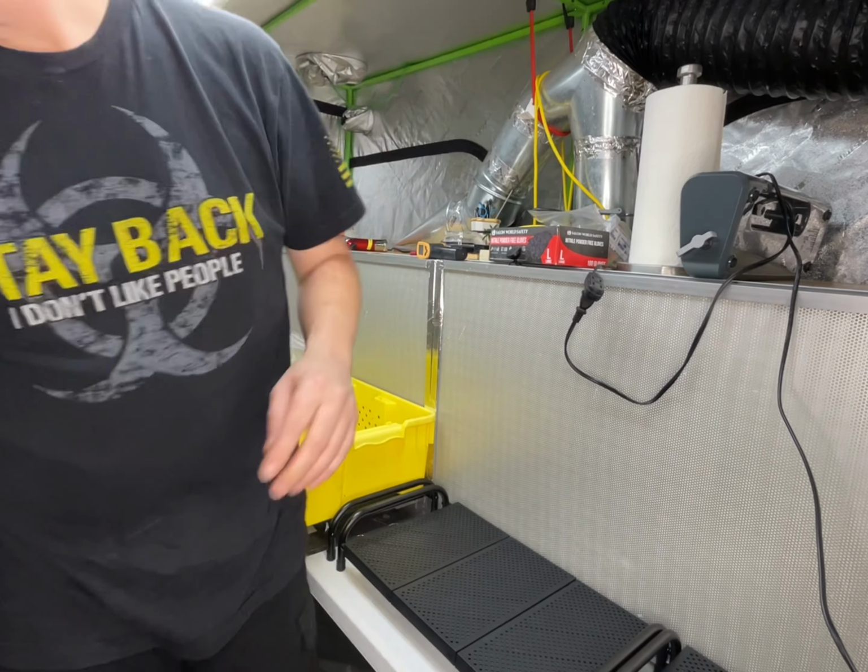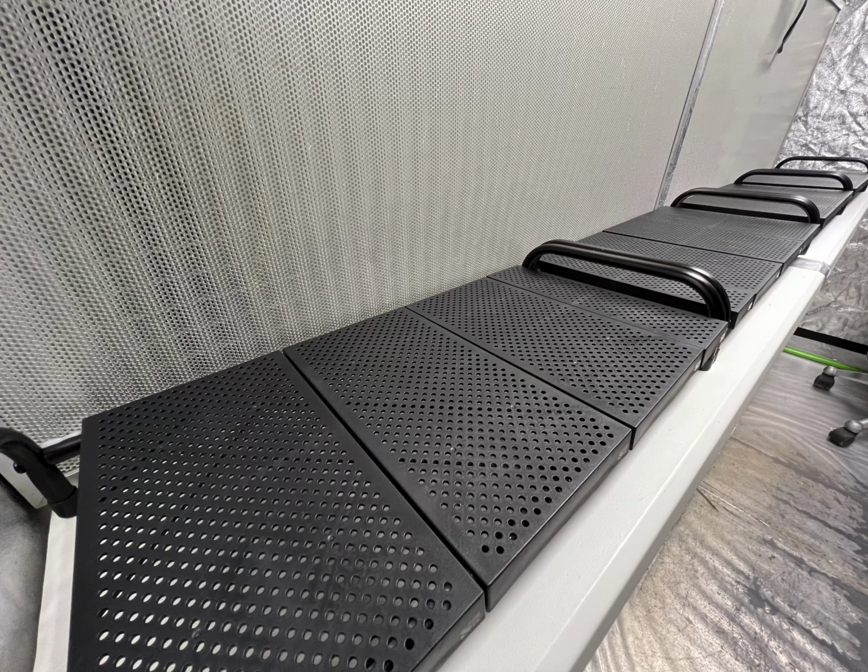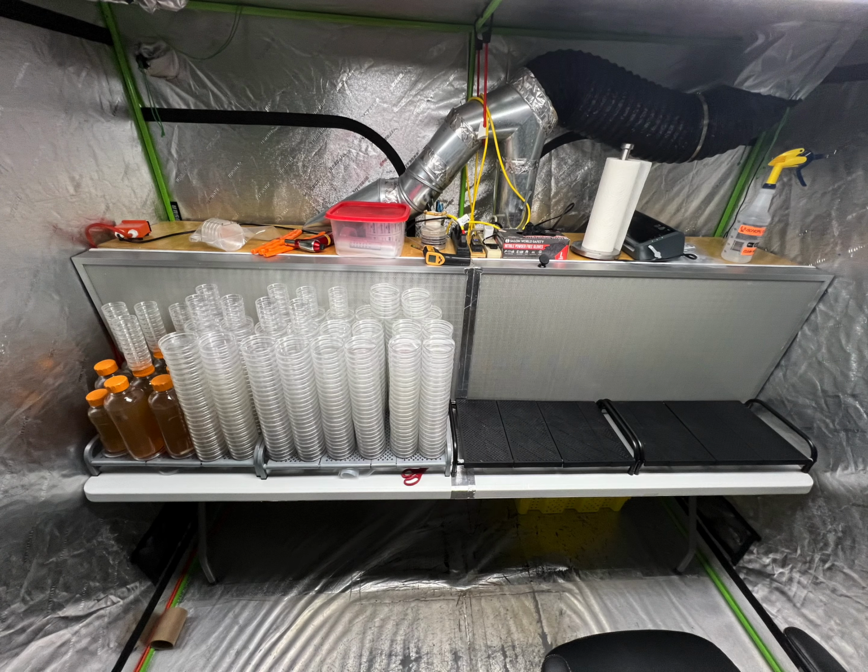So they're really nice looking. They worked out quite well. You can see here they just didn't work for me.